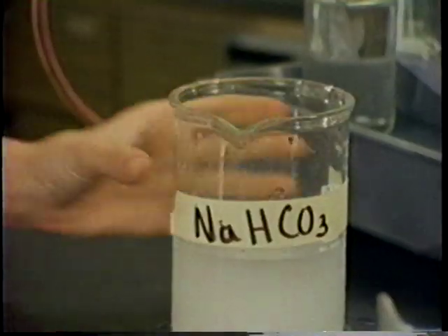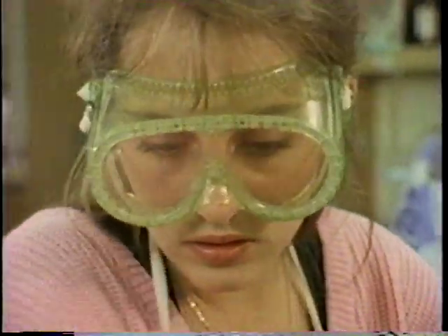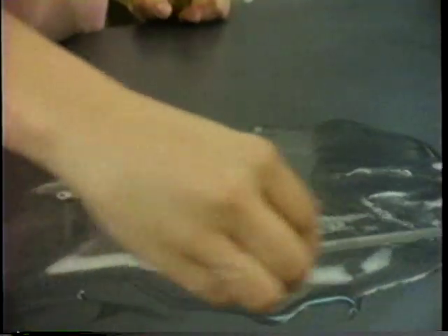Yeah, I've heard that. I figured it was time to give the kid a quick test. So what would you have done had you spilled some of that? Spilled acid can really be dangerous and should be cleaned up right away. The best thing to use is a sodium bicarbonate solution, which Mr. Petrie keeps handy whenever we're working with acids. What if you spilled a base? Use the same stuff? Heck no. If you spill a base, you should clean it up with a vinegar solution. That's an acid. You see how it works? If you spill an acid, you clean it up with a base. If you spill a base, you clean it up with an acid.